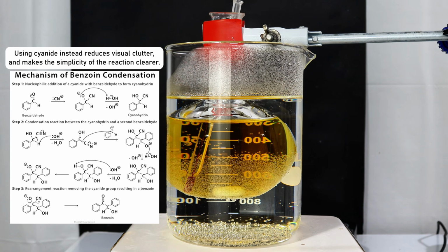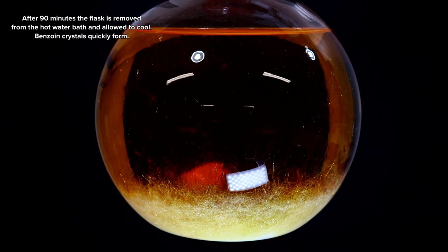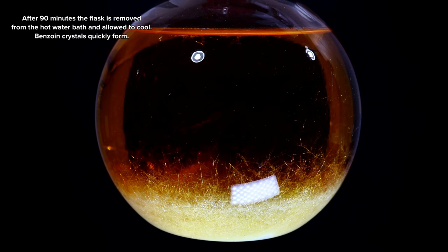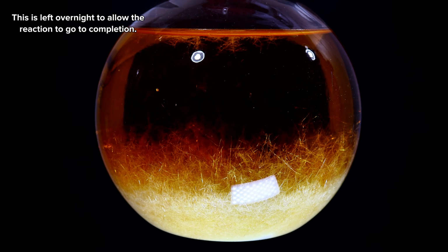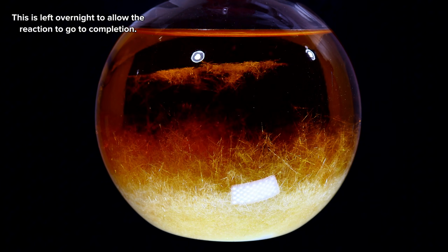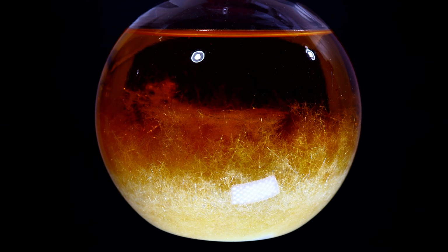After only a few minutes, very small needle-like crystals of benzoin began to form, and I allowed them to continue growing overnight. If crystals don't start growing for you here, you can always try scraping the sides of the glass, putting the flask on ice, or simply dumping the mixture directly into an ice bath.